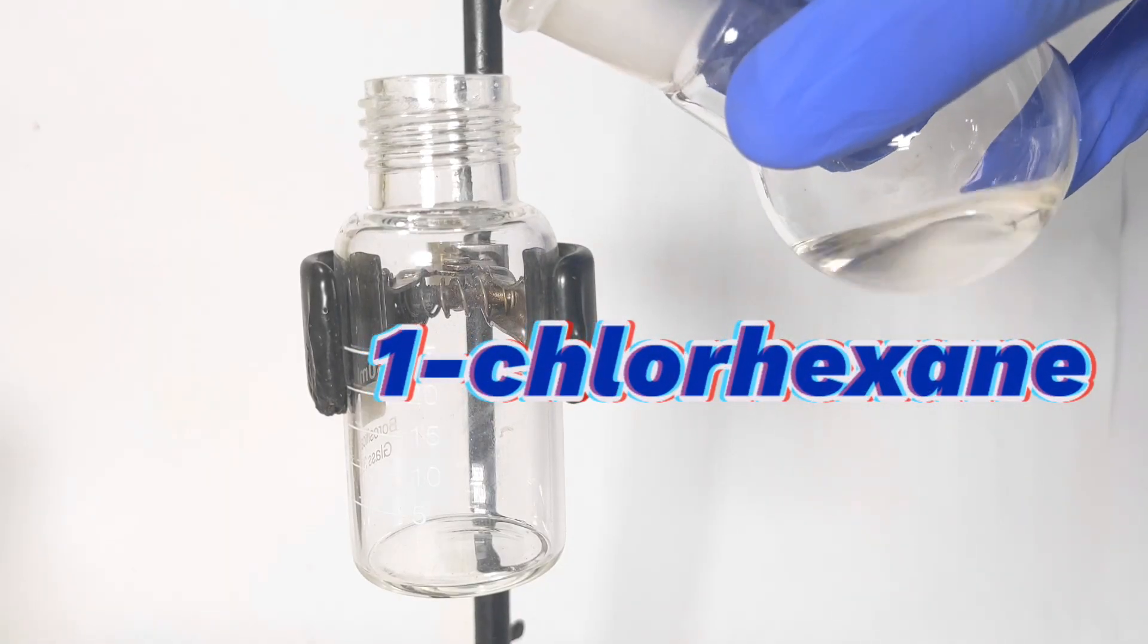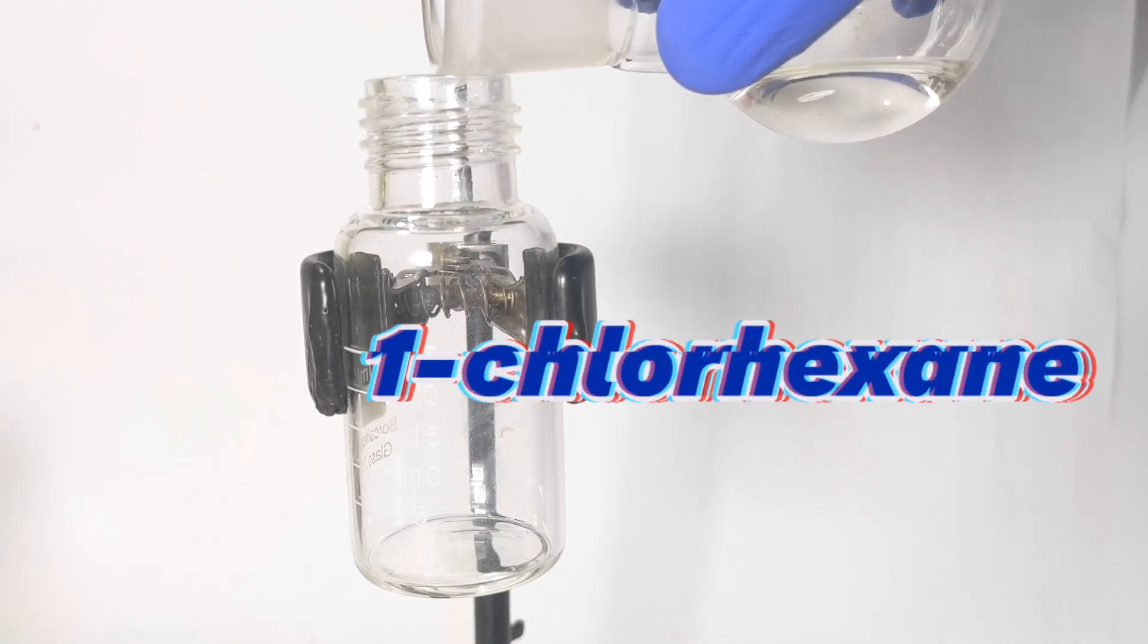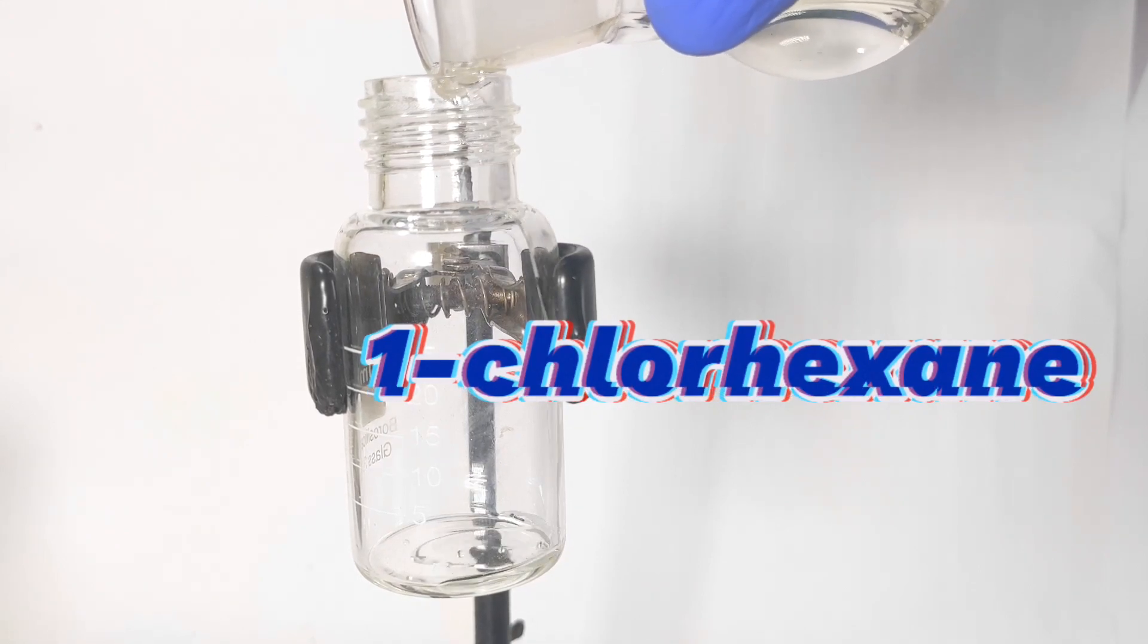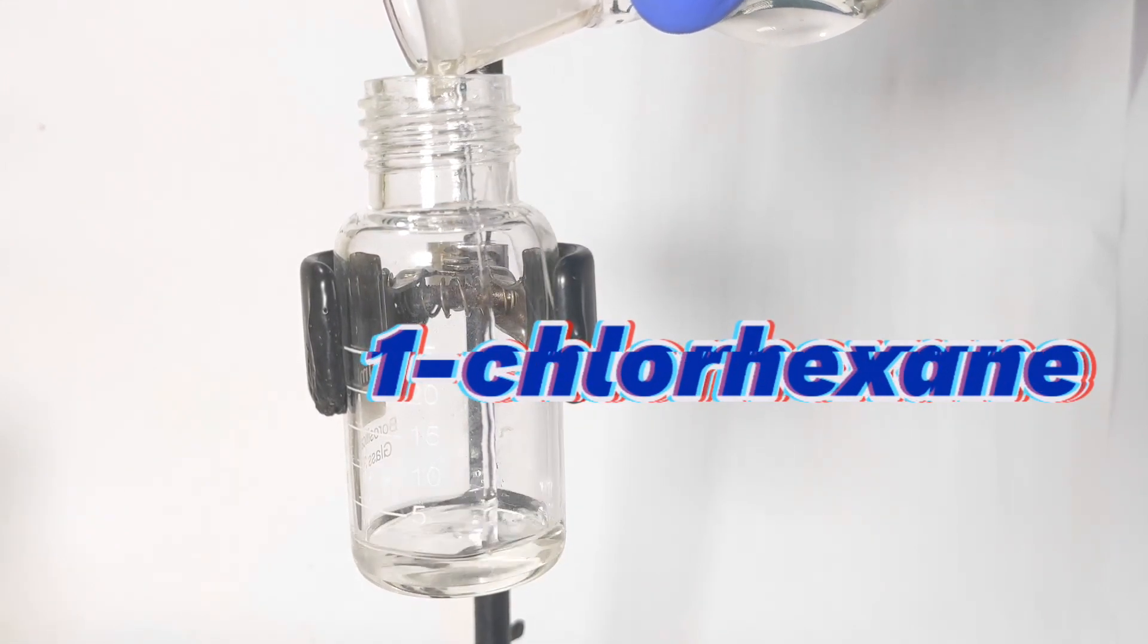Hello friends, in this video we will be synthesizing 1-chlorohexane by the chlorination of 1-hexanol using thionyl chloride.